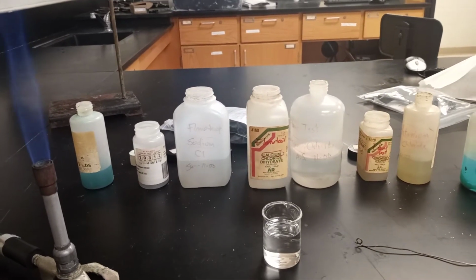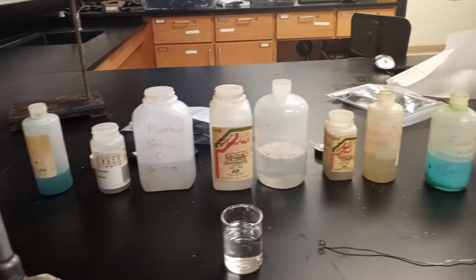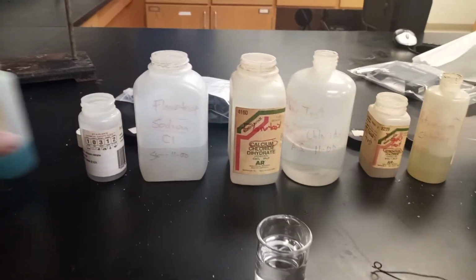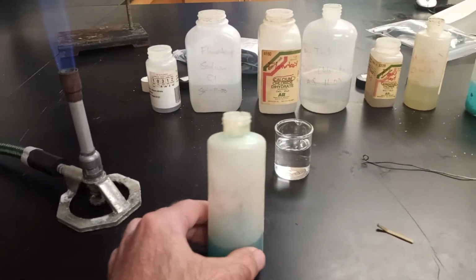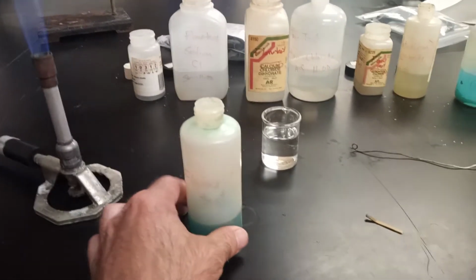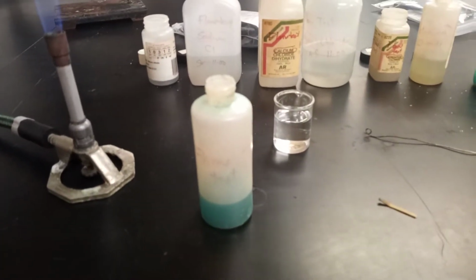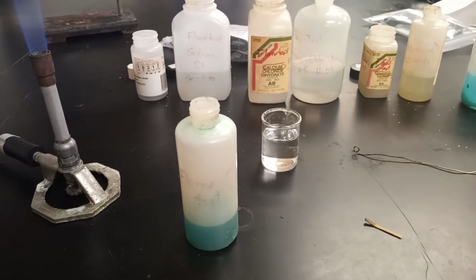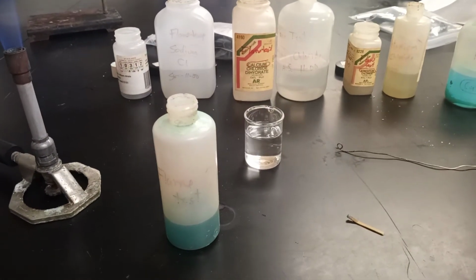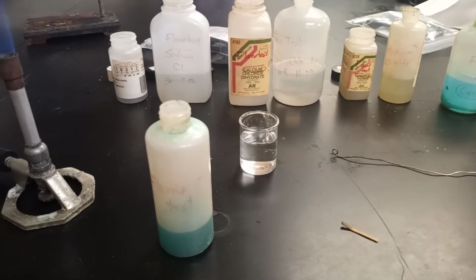Okay, so we have here a lab where our objective is to figure out what chemicals are in our unknown. This thing here says flame test unknown. So there's 3 chemicals in here. We're going to try and identify them. This is one of our simplest labs that we'd ever do, and obviously there's some analysis that needs to be done behind the scenes.